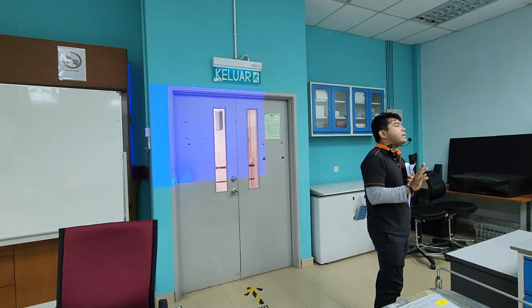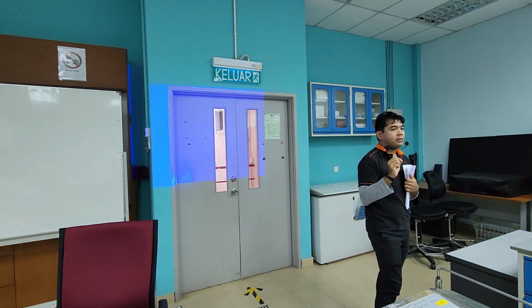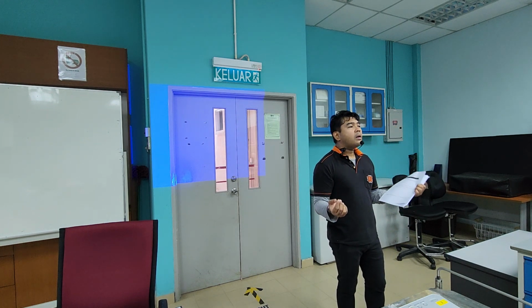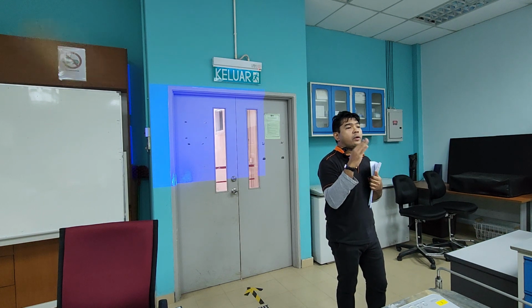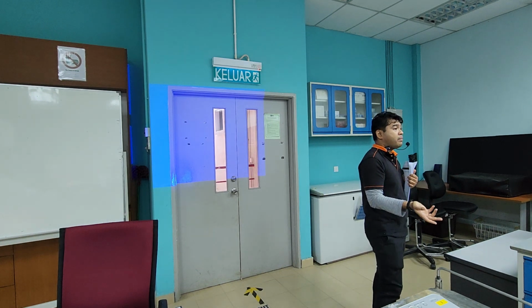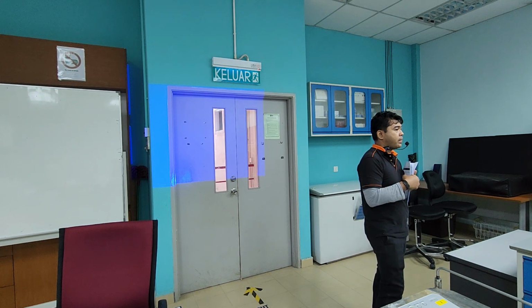So the idea is to compare between the two methods, the manual method versus the automated method. Are they going to be yielding the same results, or are there going to be some kind of discrepancy between the two? So that's what you're going to find out and make comparison and discuss a bit more about it. Maybe one method is more suitable than the other in certain cases or events, right?